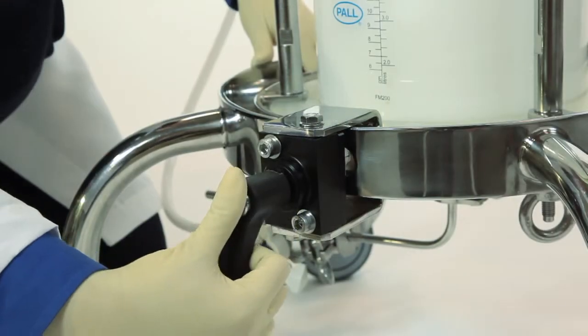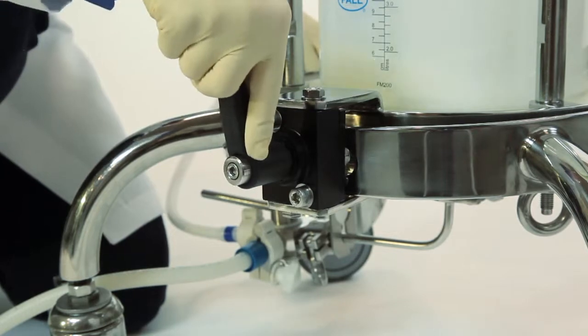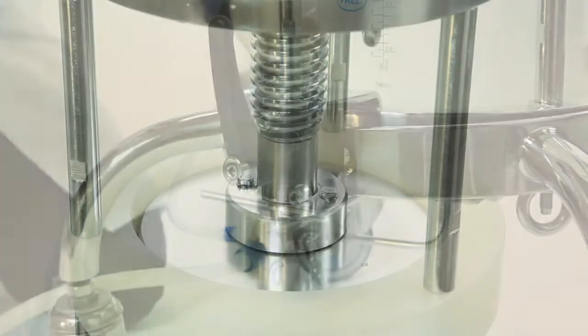Next, rotate the handle. Tilt the column and lower the adjuster to remove the air.